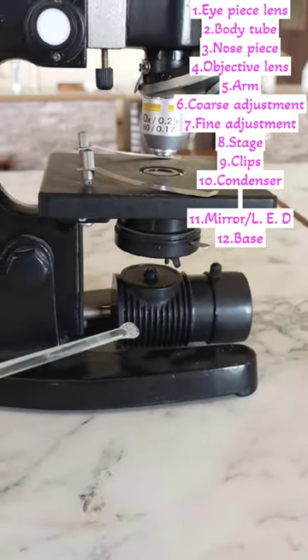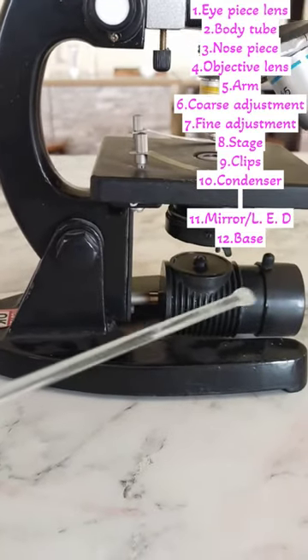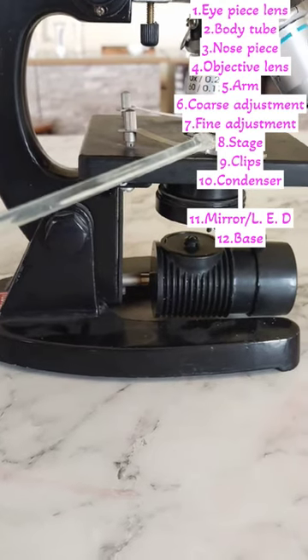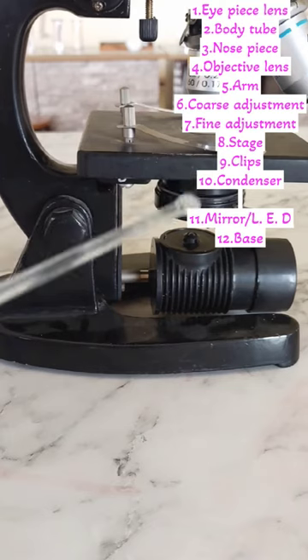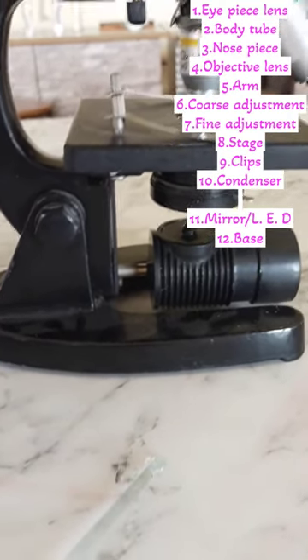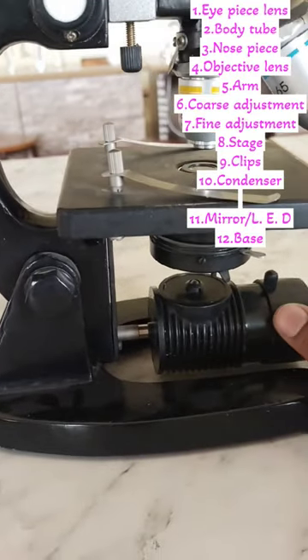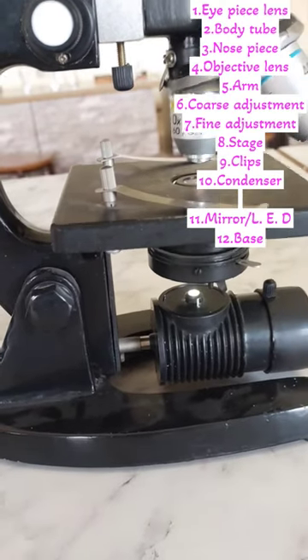This is the LED lens. Normally, the compound microscope has a mirror as its light source. Here, it has an LED lens instead. With the LED, we can use the compound microscope in the dark, and the specimen is very clearly visible.